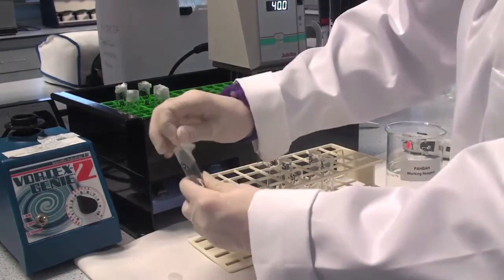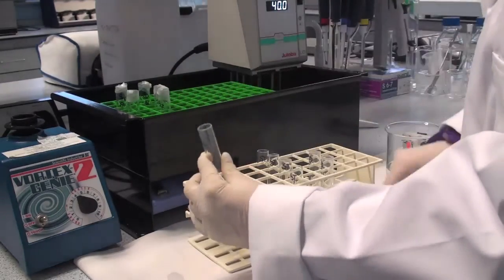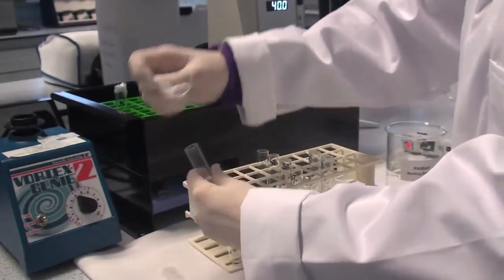Remove the tubes from the 40 degree water bath and also remove the parafilm from each tube.